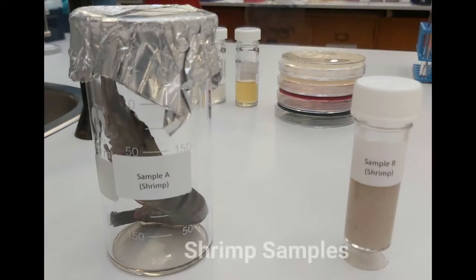You are provided with a sample of whole shrimp or shrimp tails weighing approximately 20 grams, in addition to a sample of pre-blended shrimp. These will be referred to as Sample A and Sample B respectively, with Sample B acting as the control.